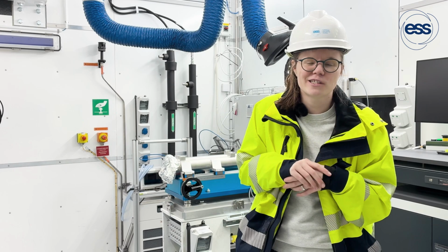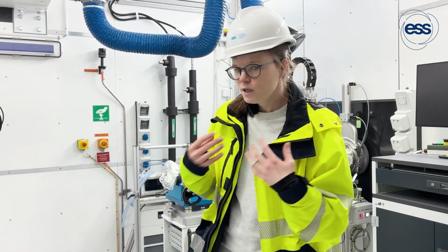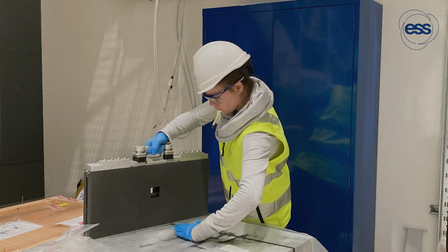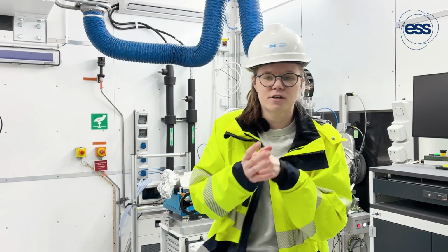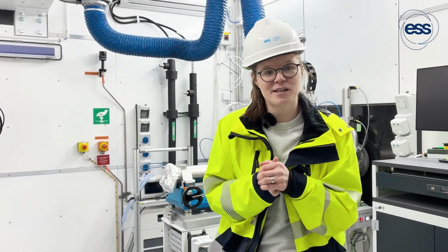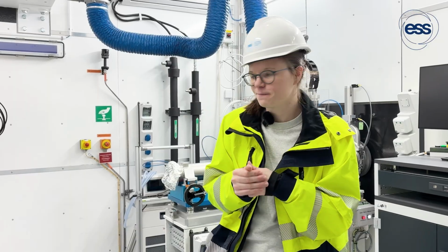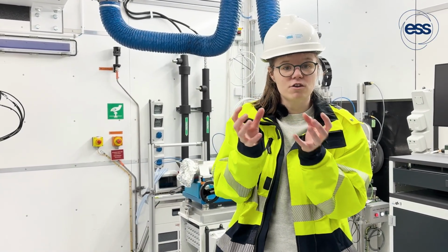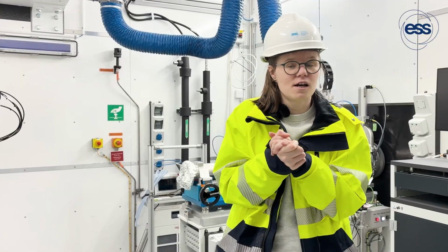And more, we're starting to see people bring in real life examples. For example, your foods. I personally measure things like pasta on a beamline to understand what's going on at the nanometer or the micrometer scale. Or we have industrial users who might come in and, for example, virus capsid vaccines have been measured a lot in these type of beamlines in order to understand their structure and how that relates to their function whenever they're injected. These structure-property relationships, between how something is structured at this minute scale versus how it behaves at the larger scale, are extremely important.